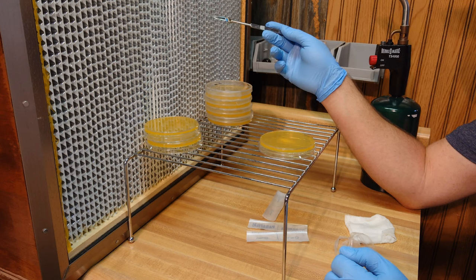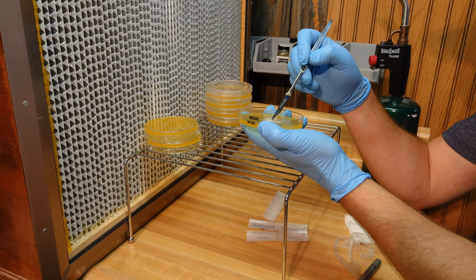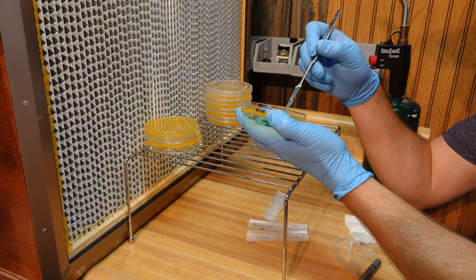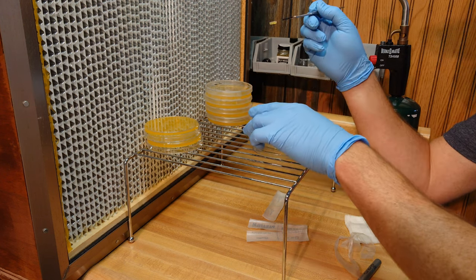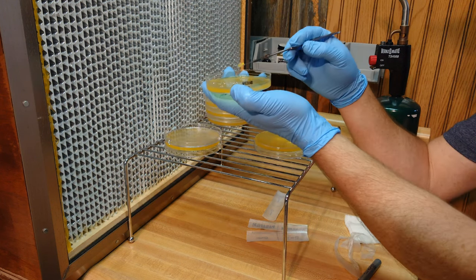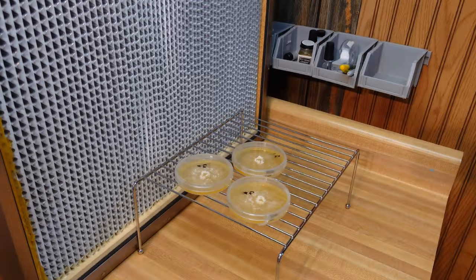You're looking to sector clean mycelium away from any potential contamination. Taking those initial clean Gen 1 plates, cutting a small agar wedge, and just like we did with the mushroom tissue, dropping that wedge onto a new clean agar plate - that becomes our second generation. Typically I'll do three generations, which is what I did with this project. Get clean mycelium on your Gen 3 plates and go ahead and take that to grain.